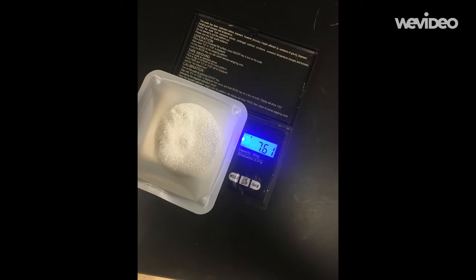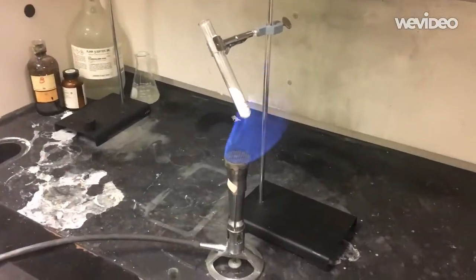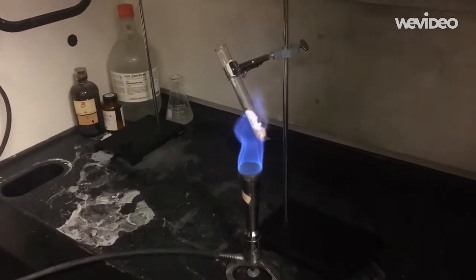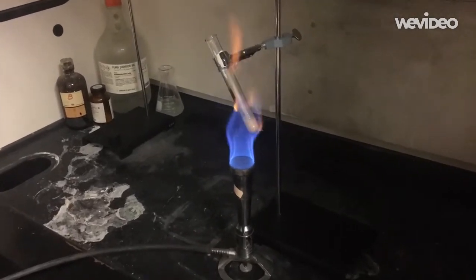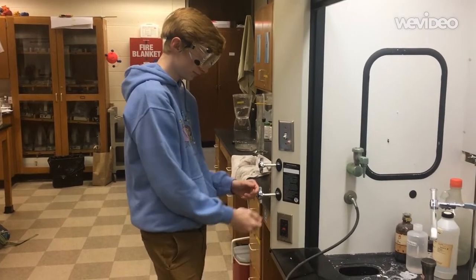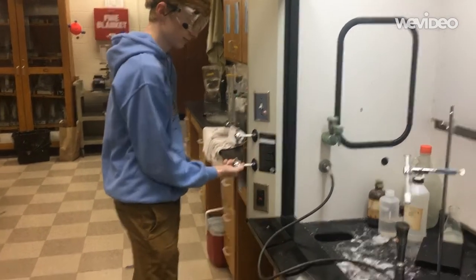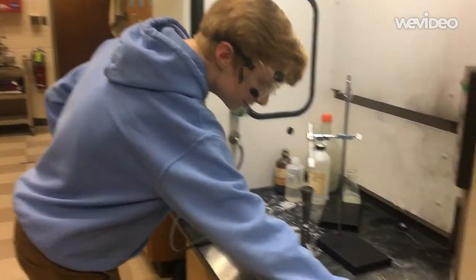The next step is to melt the solid chlorate sample into a liquid. The solid potassium chlorate will decompose into liquid potassium chloride and oxygen gas, and the sodium chlorate will react similarly. From there, the gummy bear should be added to the test tube, and the glucose in the gummy bear will react with the oxygen gas in a combustion reaction, which you'll see in a minute.